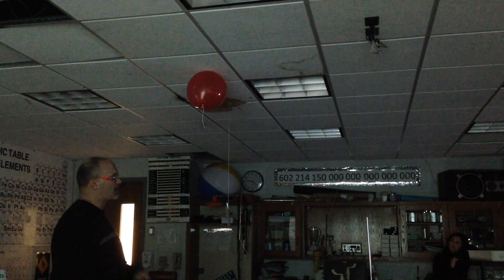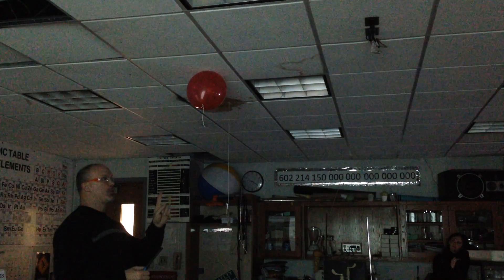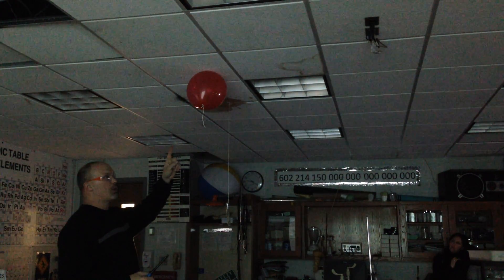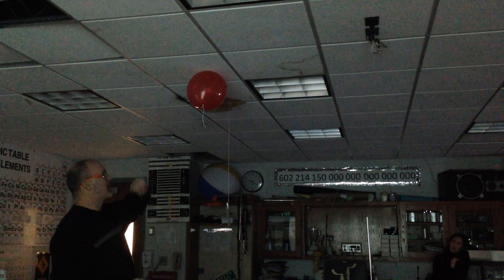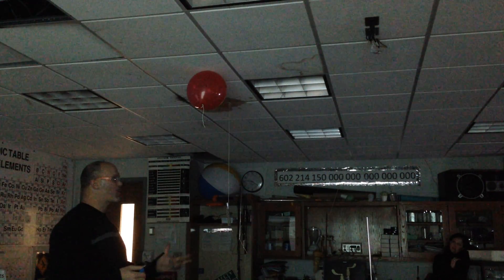In fact, a lot of the hydrogen goes unreacted. It's an incomplete reaction — sometimes we call it incomplete combustion. In this case, I put the right ratio, hopefully, of oxygen. Assuming my oxygen I made is pure, I have a two to one inside, so every hydrogen molecule will find that O2 to make water. So this is the water-making reaction.